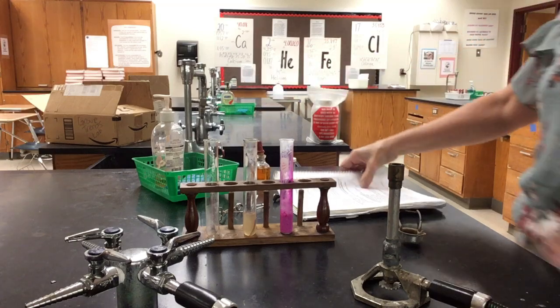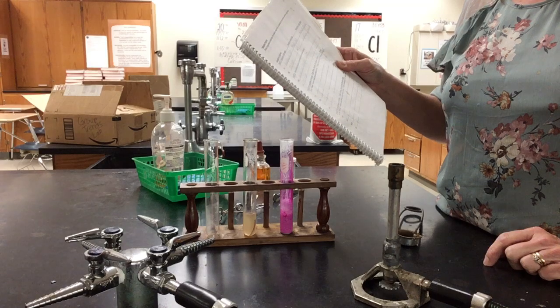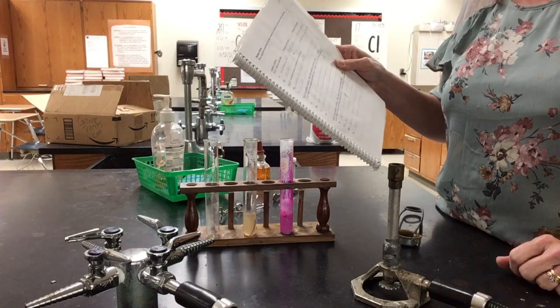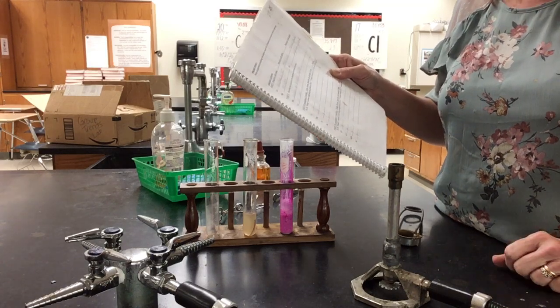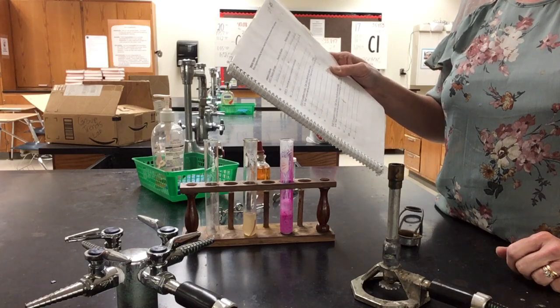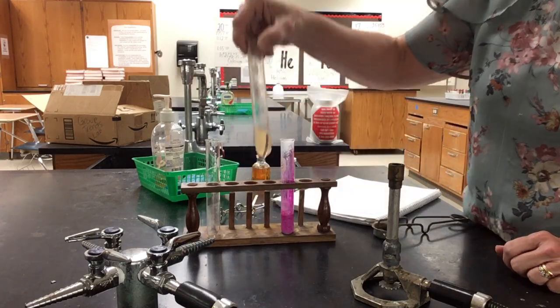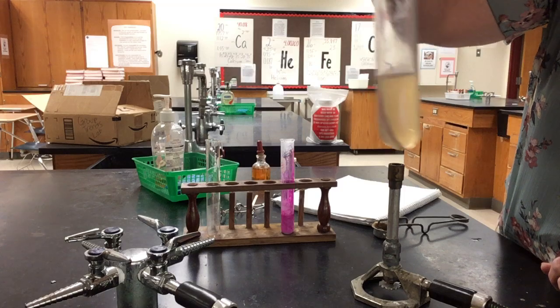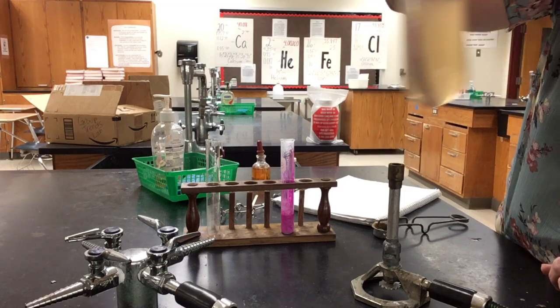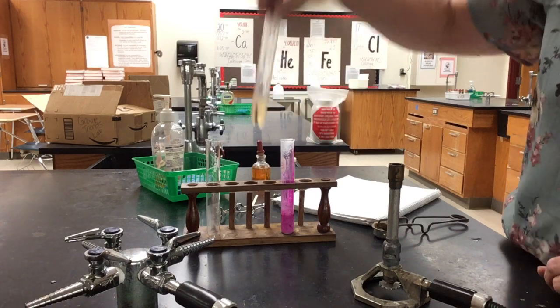In your lab book, we already have it marked that we're not going to try to do that with the popping. It says NR, not going to react that way. So we didn't have enough of a reaction with the water in order to create that hydrogen, but it should turn slightly pink. And again, if you look right at the metal before it flops to the opposite side, you should see that the metal is pink.